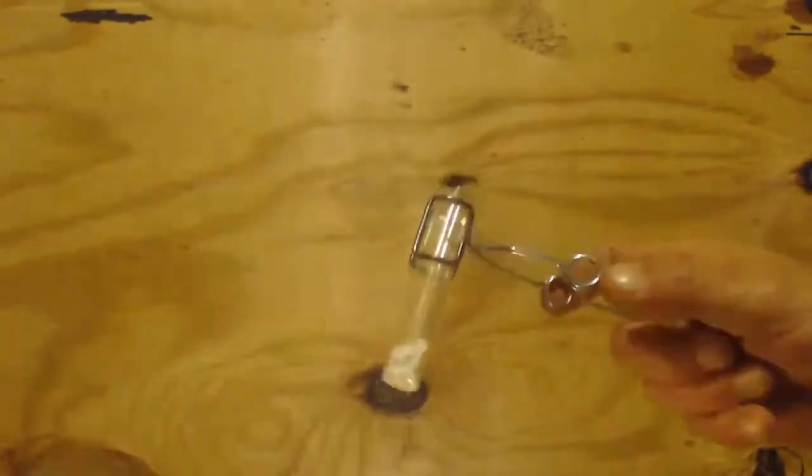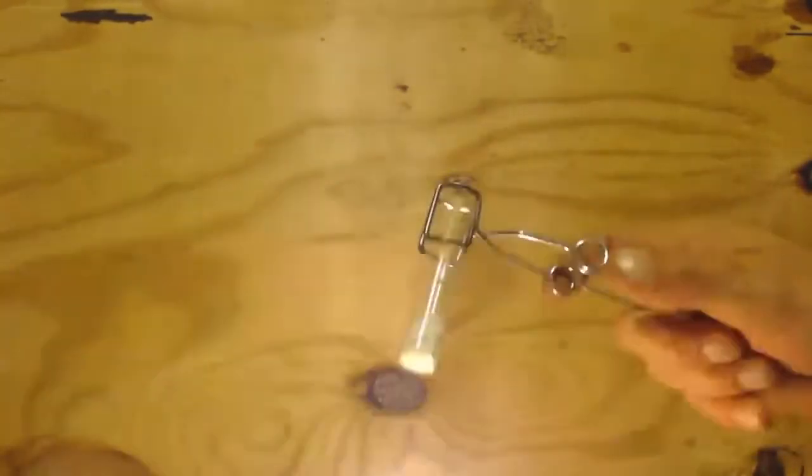I'm going to try to make some calcium oxide. I got some calcium carbonate here, 2 grams of it. The reason I'm doing this is I want to make sure that it's all carbonate. There could still be some hydroxide in there.